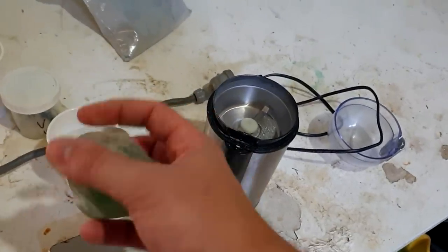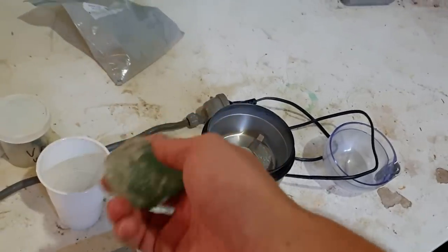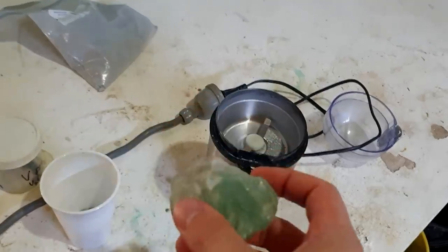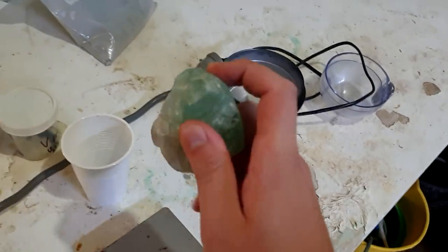The catch is obviously that this is a bit of a heat sink — melting this gives no heat, there's no reaction going on, so you don't get any heat out of it. So it's a heat sink, which is actually good in our case — it should slow down the reaction. The real question is how much of this do I add, and that is an answer I don't know. I can't find any information about amounts to add.